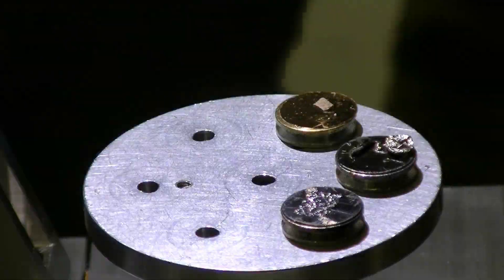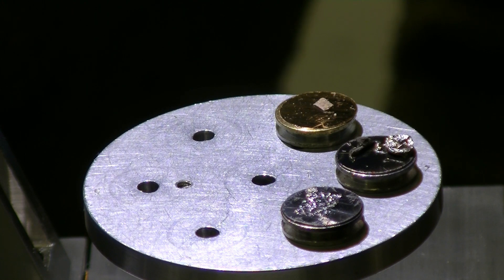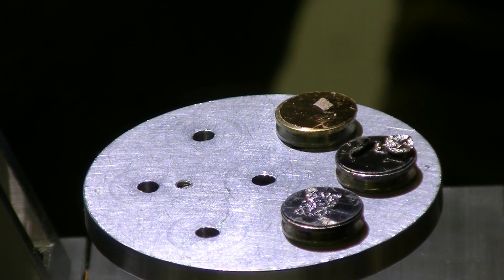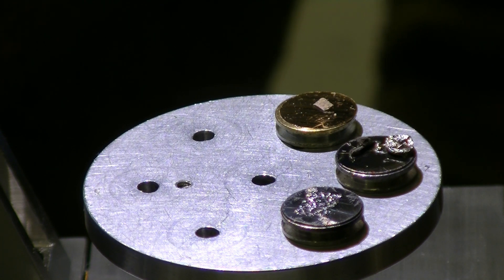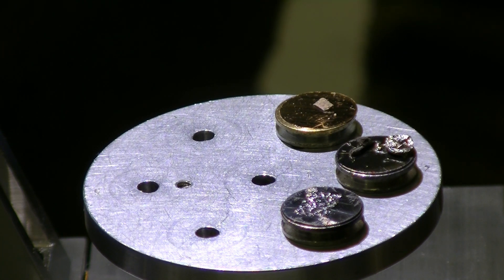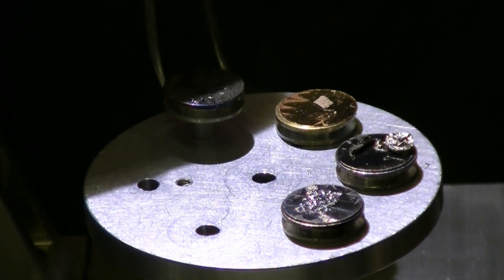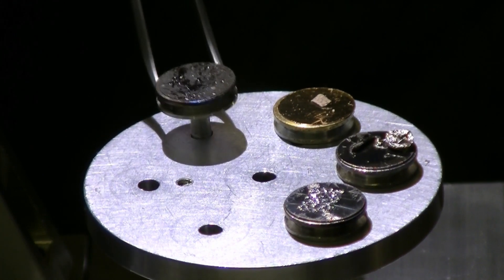Samples that we scan in a scanning electron microscope must be dry and they need to be conductive. Biological samples are fixed and dried in a special way so that they maintain the shape and size that they have in real life. To make samples conductive we add a very thin layer of metal such as gold or platinum over the surface.